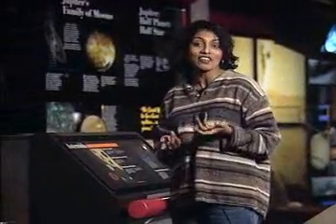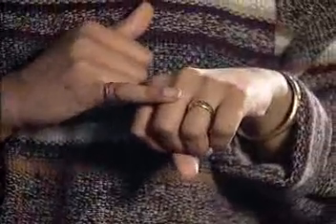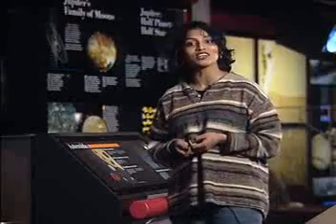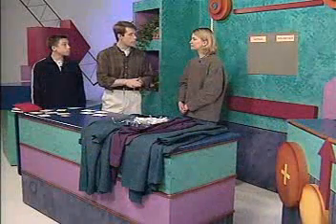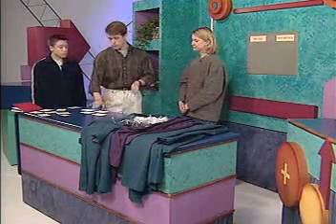Some metals react violently with other chemicals, and others don't seem to react at all. By observing chemical reactions, we can tell a lot. They can even help us group elements together. Now, we're off to the lab to experiment with 4 different metals.